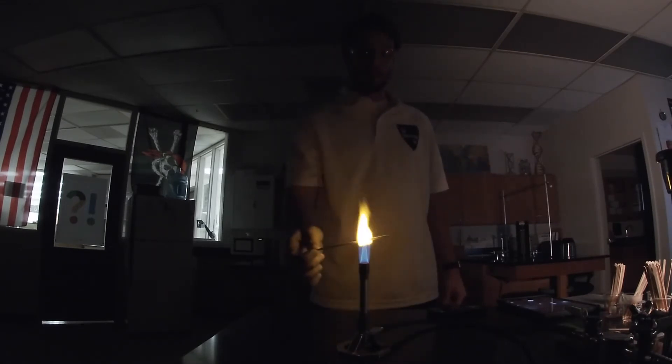Next I have zinc. Zinc is a peculiar flame test because the color of the emission is actually outside of our visible spectrum — we cannot see it. It is UV, and so when I do this flame test it looks like the flame is just turning invisible. I get no visible color from the zinc flame test. The next one is sodium, which gives a nice orange color.